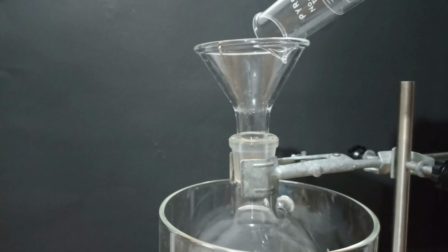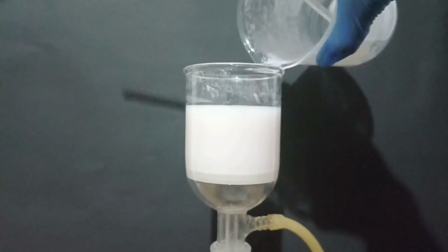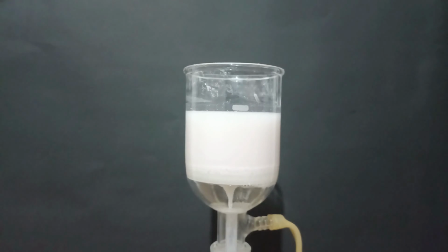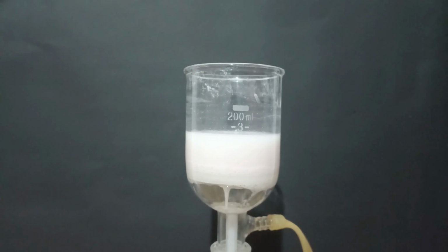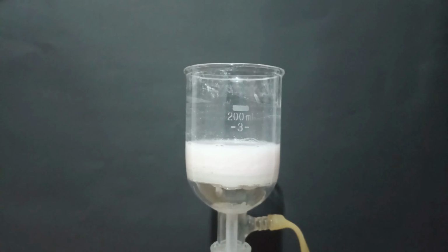It means at pHs below that, p-aminophenol will be protonated on the amino group, and the other pKa is at 10.17. It means at pHs above this, it will be deprotonated on the phenol group. After reaching a pH of approximately 7, p-aminophenol in its free base form started precipitating, so I filtered it out.